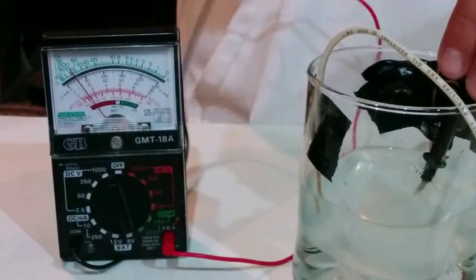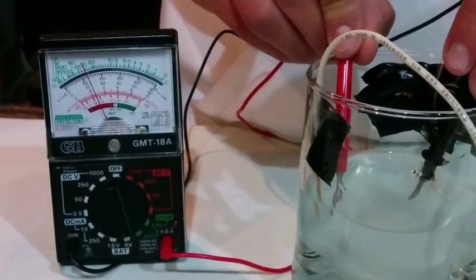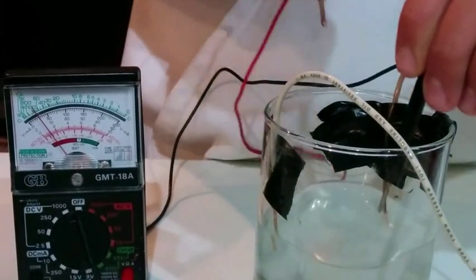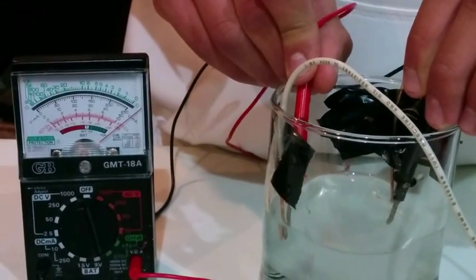Now, when I connect the actual prong to the wire, you can see it jumps right away. So this one will stay in the water not touching, and this one will touch very quickly.